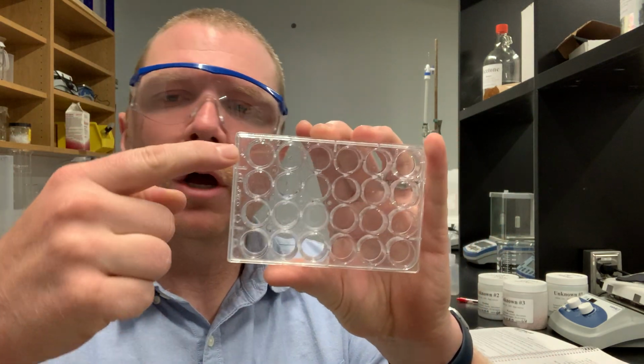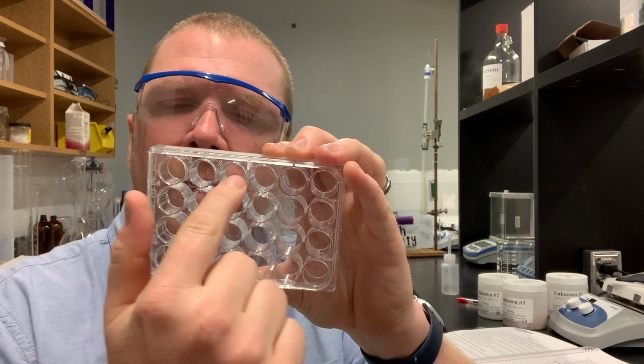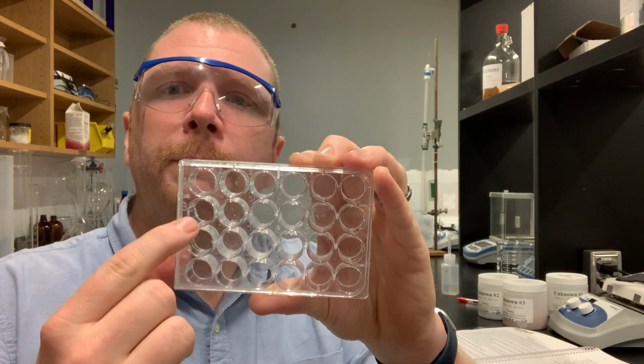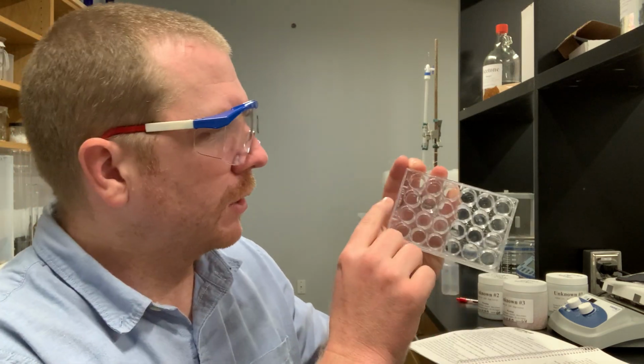Now, what we are going to do for this procedure is take another well plate and across samples A1 through A4, we're going to put sodium hydroxide in there, okay? Now for B1 through B4, we're going to put potassium hydroxide in there. All that we're going to be doing is adding approximately maybe a half a milliliter to a milliliter of each solution in there. So A1 through 4, sodium hydroxide, B1 through 4, potassium hydroxide. That's all that we're going to be doing with those.